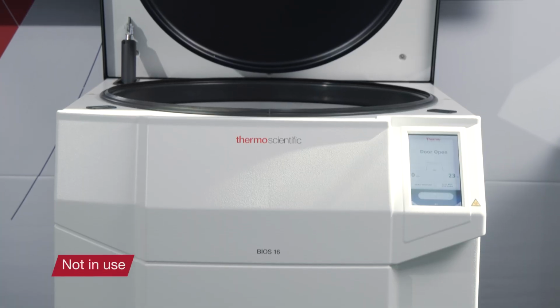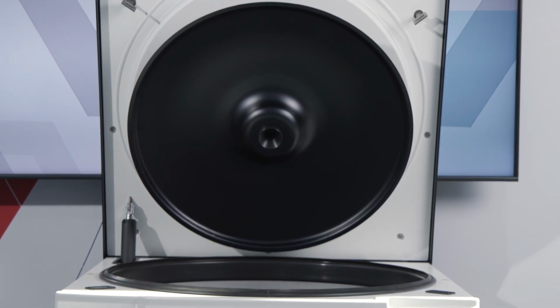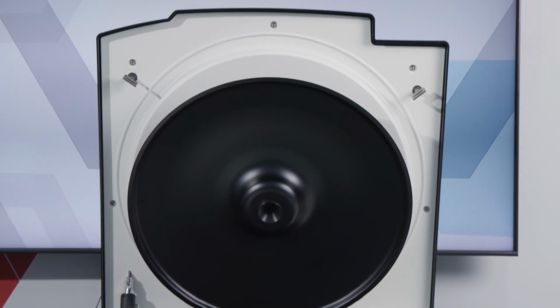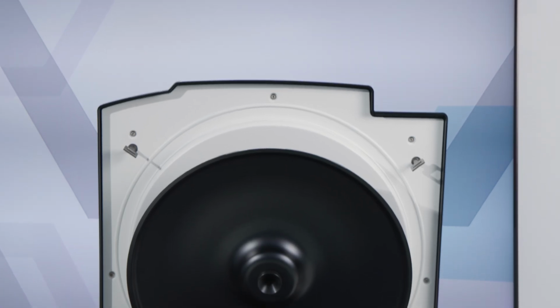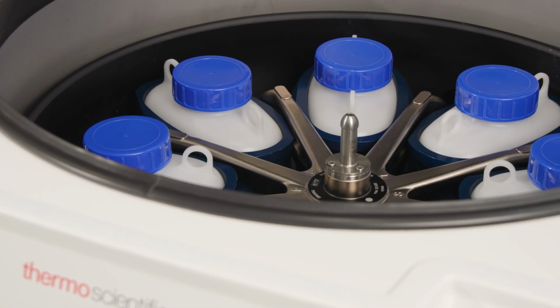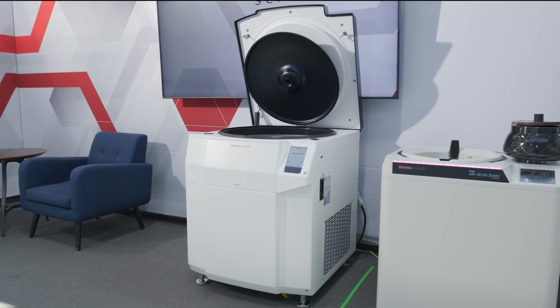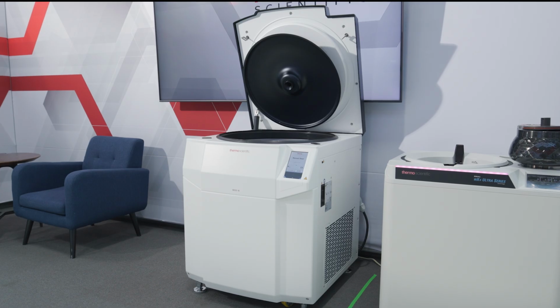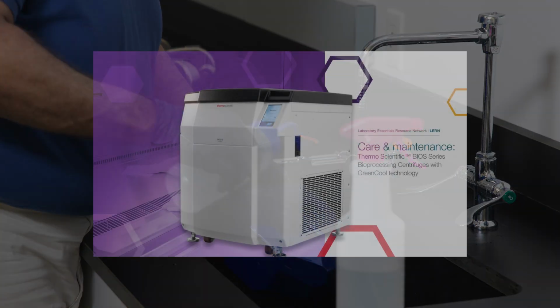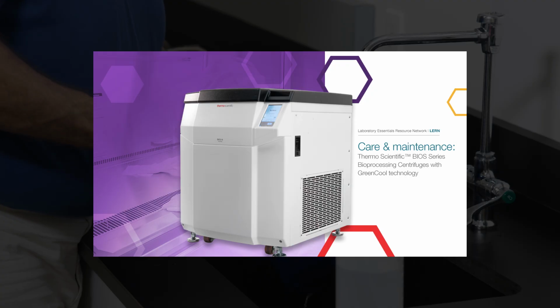When the centrifuge is not in use, keep the door open or turn off the power. This prevents the compressor from cooling and causing condensation buildup, which can lead to moisture-related issues such as corrosion and mold growth. It's an important practice that can help maintain the equipment's performance and longevity. For more care and maintenance information, please refer to our care and maintenance video.